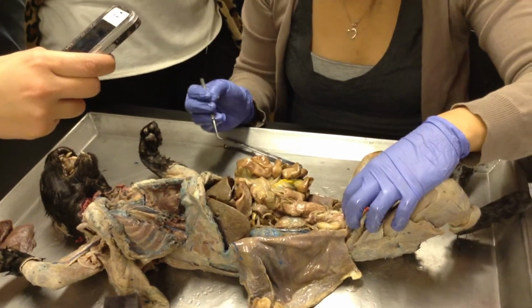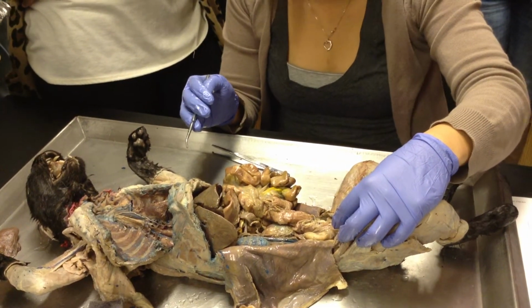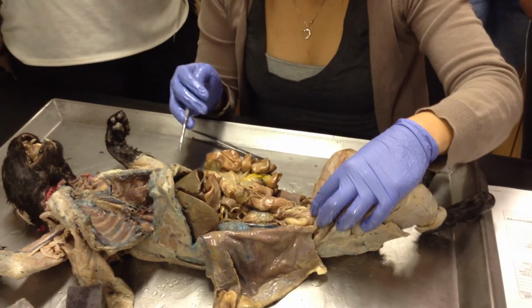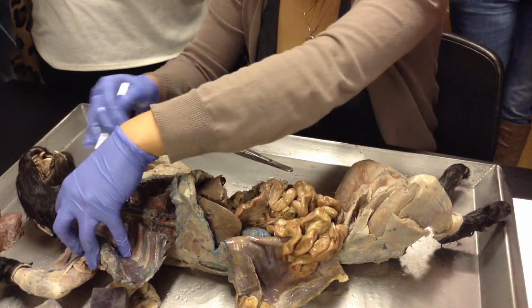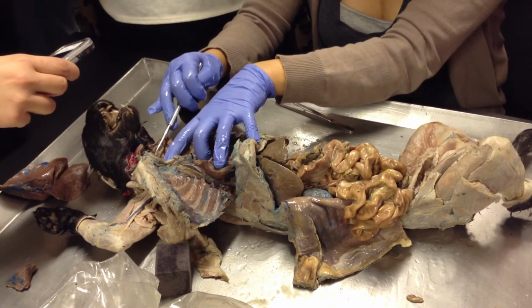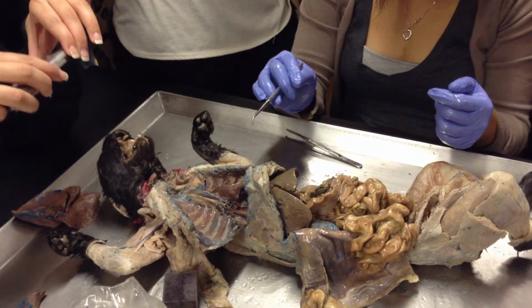Through the urethra. What's on top of the kidneys? The adrenal glands. Good. Expect that on the models, right? The models will be on the exam too. What else can I ask you? Oh, yeah. This structure right here is the what? The trachea. Once the trachea branches off into two separate tubes, that is the bronchi. Good.